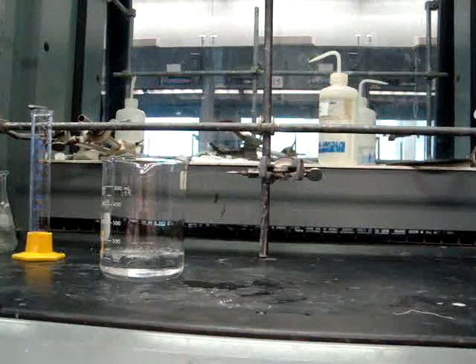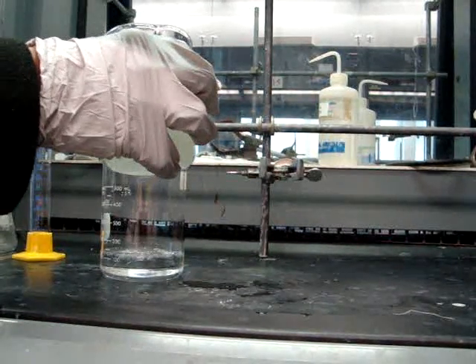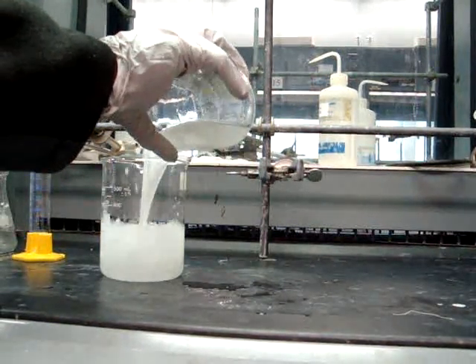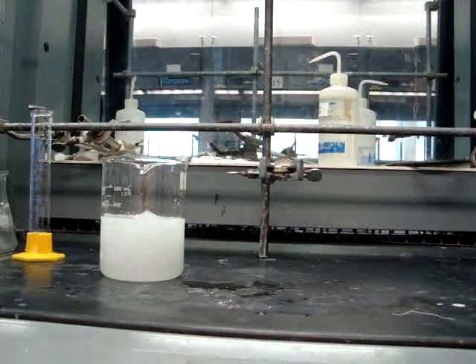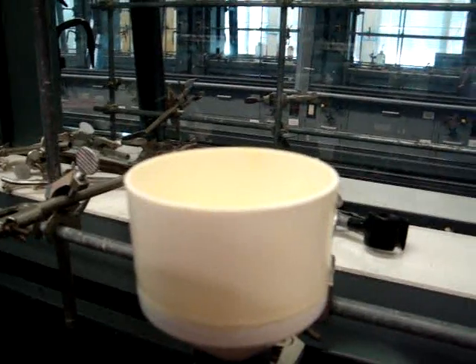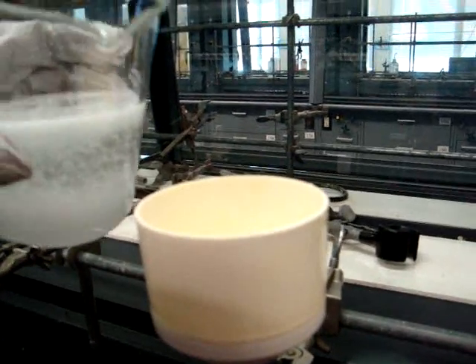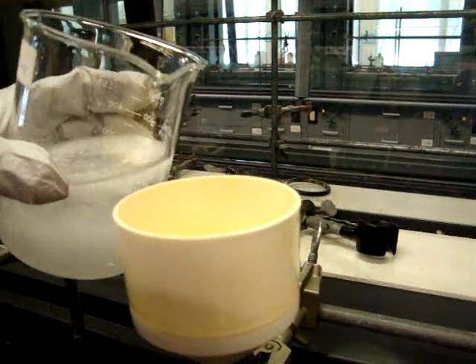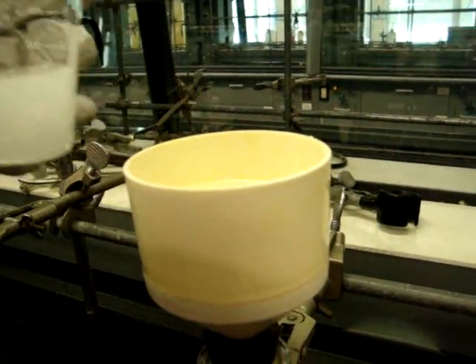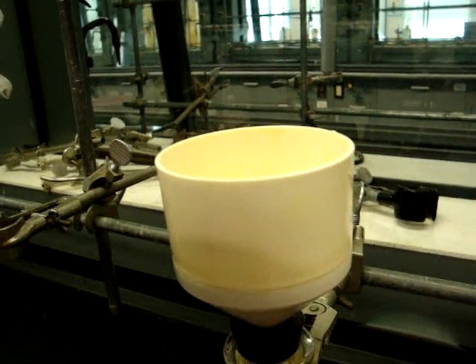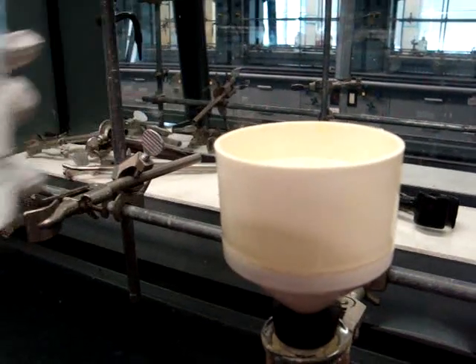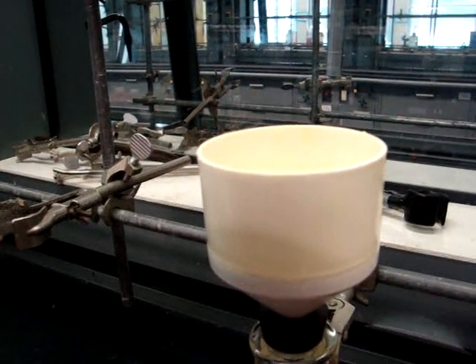Now you'll pour your mixture over 100 milliliters of brine, saturated sodium chloride, and ice. You'll want to take about 100 milliliters of brine and a fistful of ice. You will then collect the solid by filtration on a Buchner funnel and wash it with sodium bicarbonate. Now you'll be using vacuum filtration to collect your solid. You'll be washing your solid with saturated sodium bicarbonate solution until foaming is no longer evident. You'll want to air dry your solid for 15 minutes using high vacuum. If you have any questions regarding vacuum filtration, refer back to previous videos discussing it.